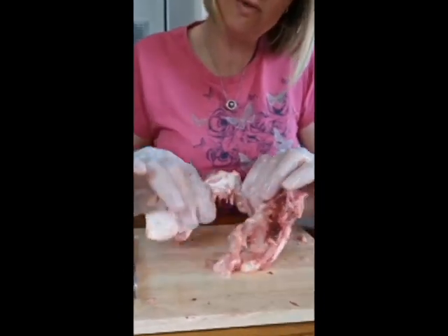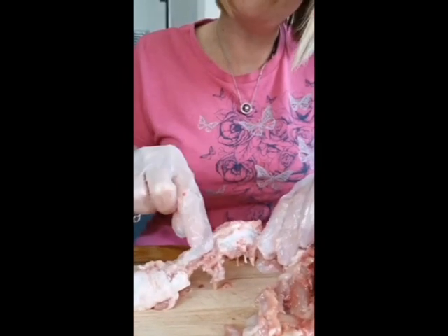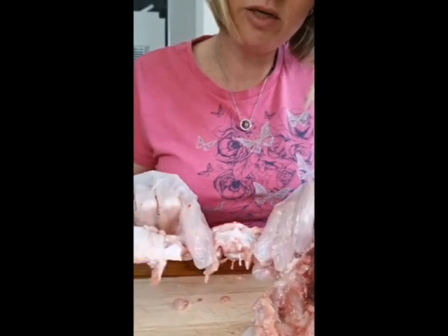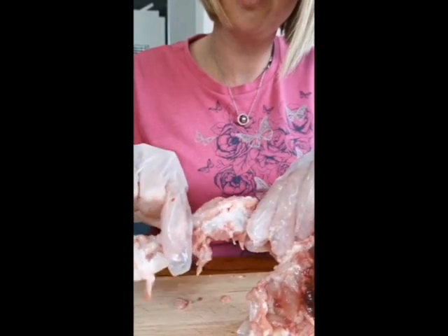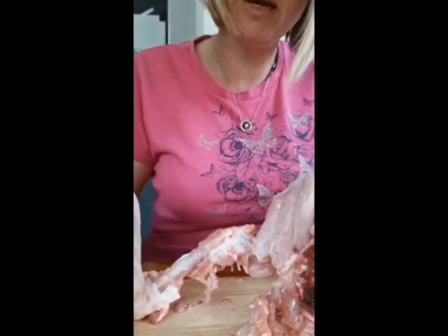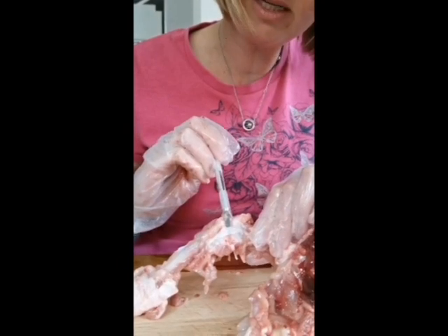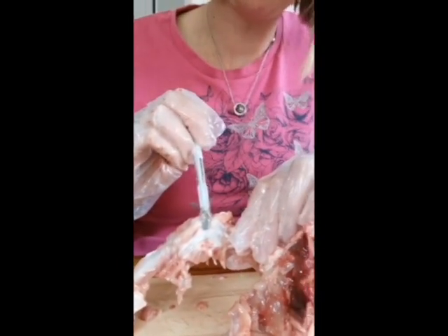So what we've got is the knee and the two bones, okay? And bones need to be held together so that they can actually work. It needs to be connected to a muscle, but the bones need to be connected to each other as well. So hopefully as I move this up and down, you can focus on the white strip between the two bones. That's the ligament that we're looking for. And I've worked really hard to expose it. It's just here underneath the scalpel blade. You see that white strip there? That's the ligament, and that's holding the two bones together.